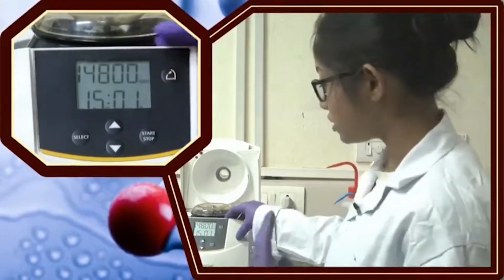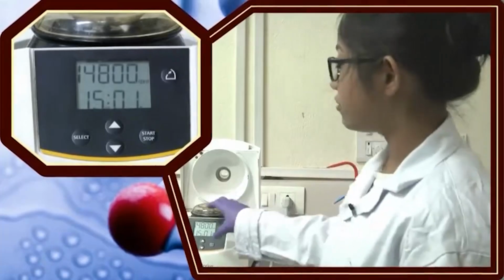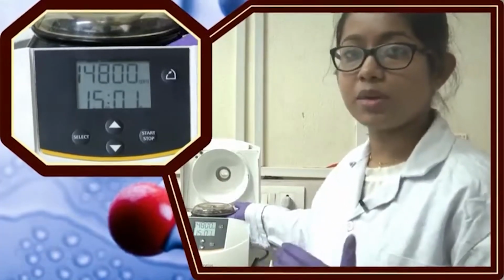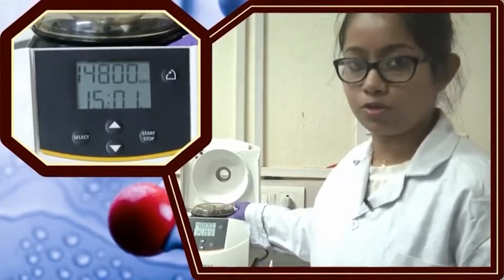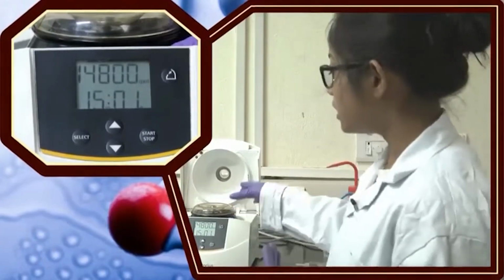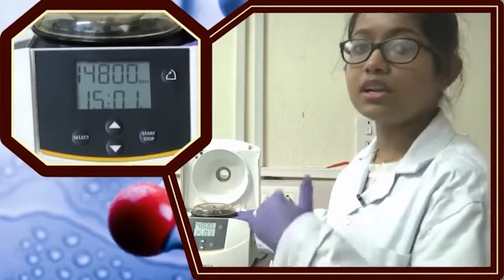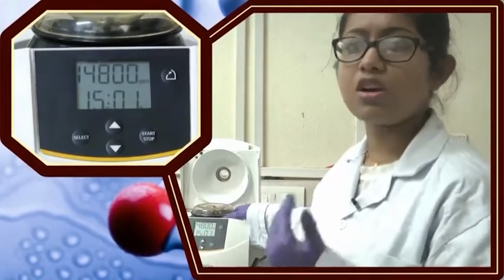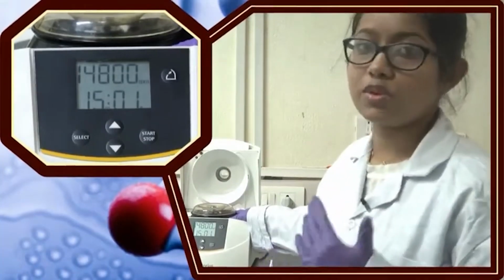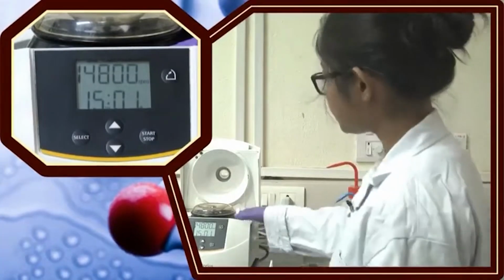If someone says you have to rotate at 5000 rpm, depending on the different centrifuge machine and the rotor size, that 5000 rpm can generate different kinds of G force. But if someone says 5000 G, that means in this centrifuge machine, that 5000 G will be similar to another centrifuge machine which has a bigger or a smaller rotor than this. So, you should be careful what kind of G force you are applying for a particular centrifugation procedure.